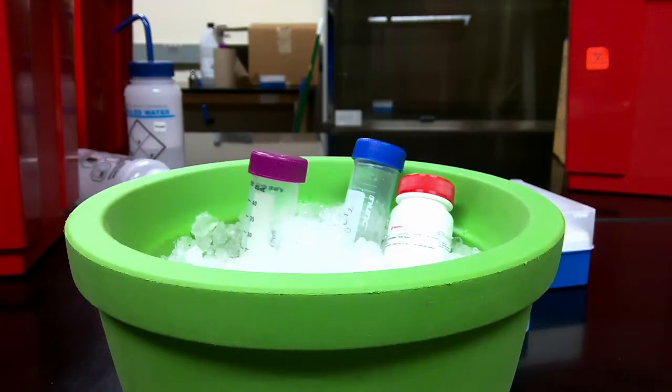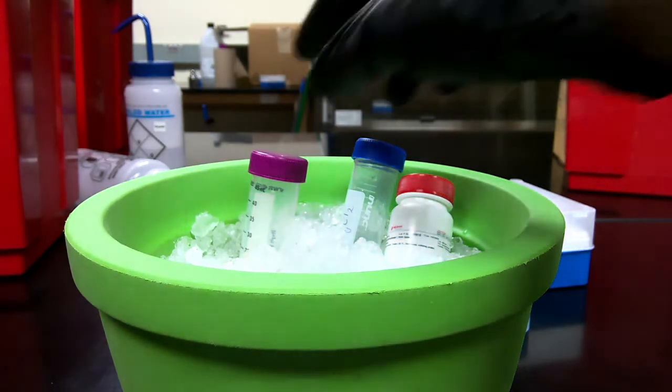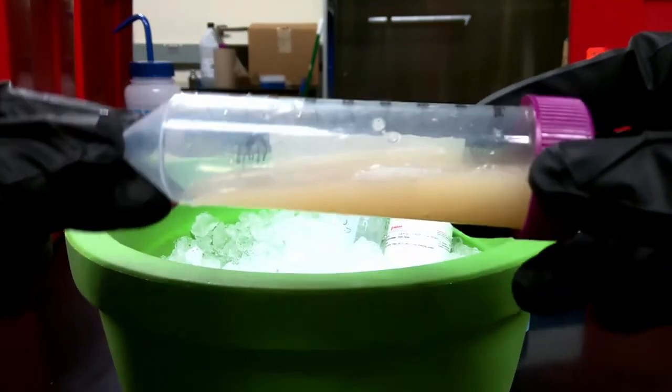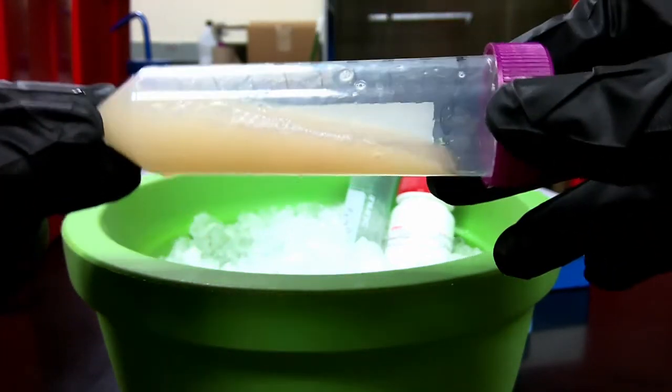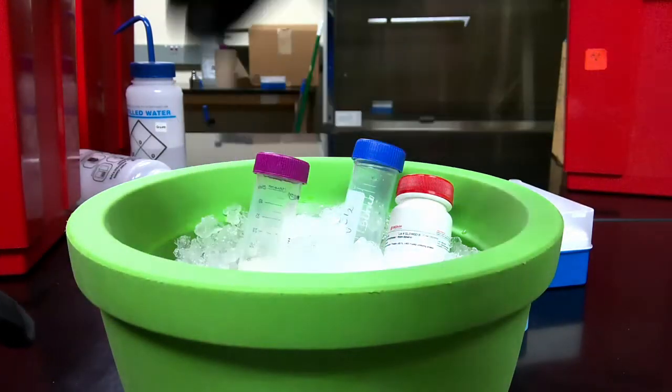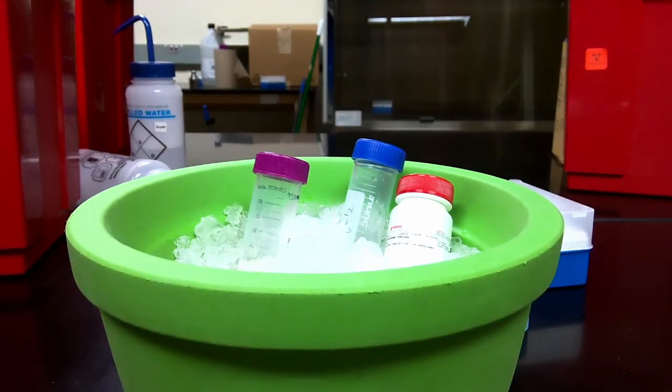Alright, so I've now finished my 3rd freeze-thaw cycle, so I'm pretty sure that now our cells are completely lysed. A good way to know that the cells have been lysed is when you look at the solution, you can see that it doesn't flow as well. The solution has become incredibly viscous, very clumpy. The reason for that is because we lysed our cells, everything inside the cell moved outside the cell, and this includes the DNA. So all the DNA that was in those cells can act like a net and wrap around all the proteins as well as all of the other trash that's in the solution right now.